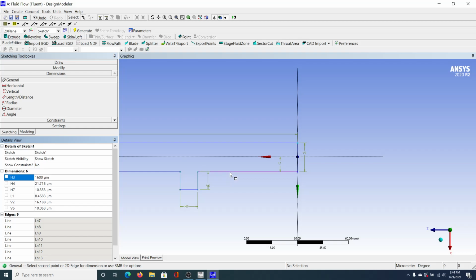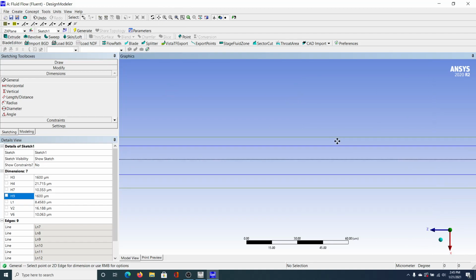I guess what I'll need to do is, I forgot this dimension too. So you can either do this dimension or this dimension. And so let me just do this one. And H9, we're going to make that 1600. Hit enter. So that way it makes it even. And then now I'm going to go over here and pan. Where is it? Here. I'm going to pan over. Click and drag.